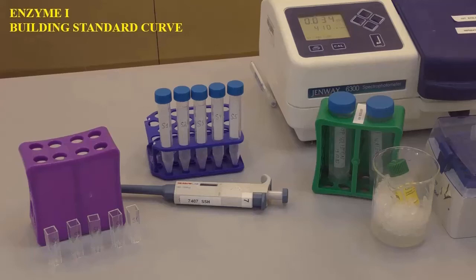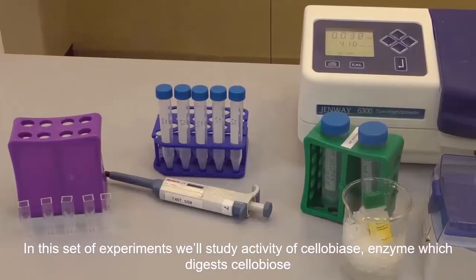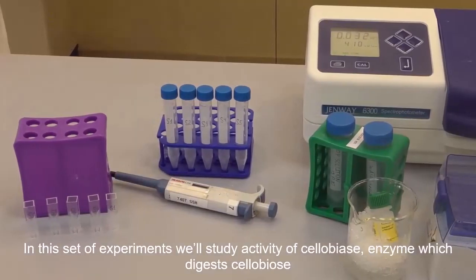Hello everyone, today we start a new set of experiments about enzymes, and in this set of experiments we will study the activity of cellobiase, which is the enzyme that digests cellobiose.